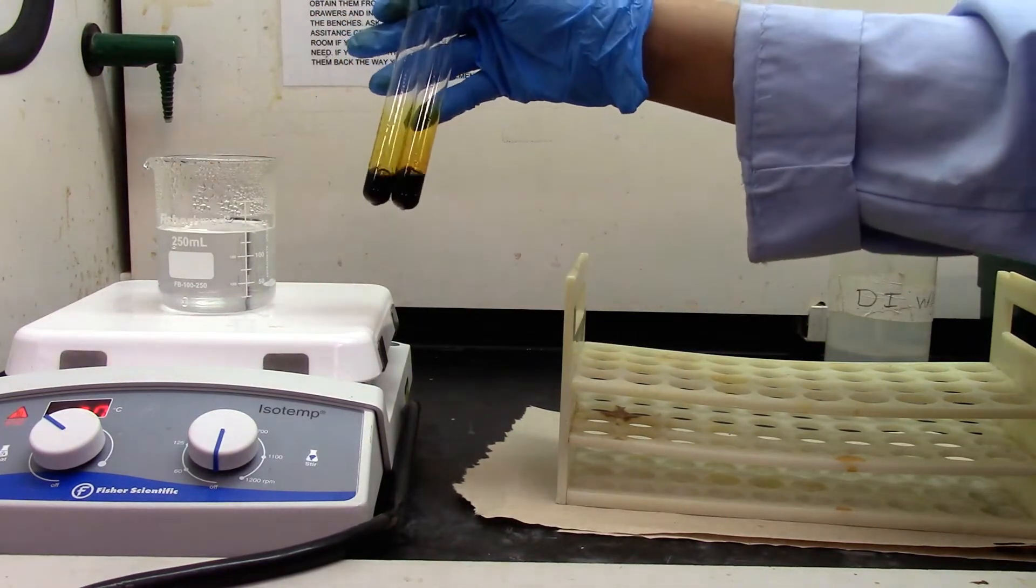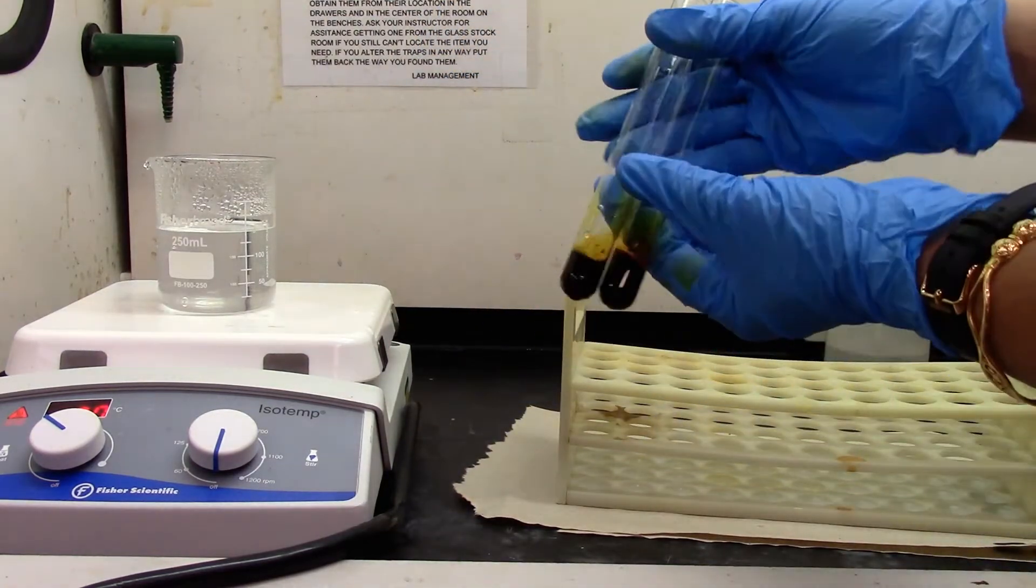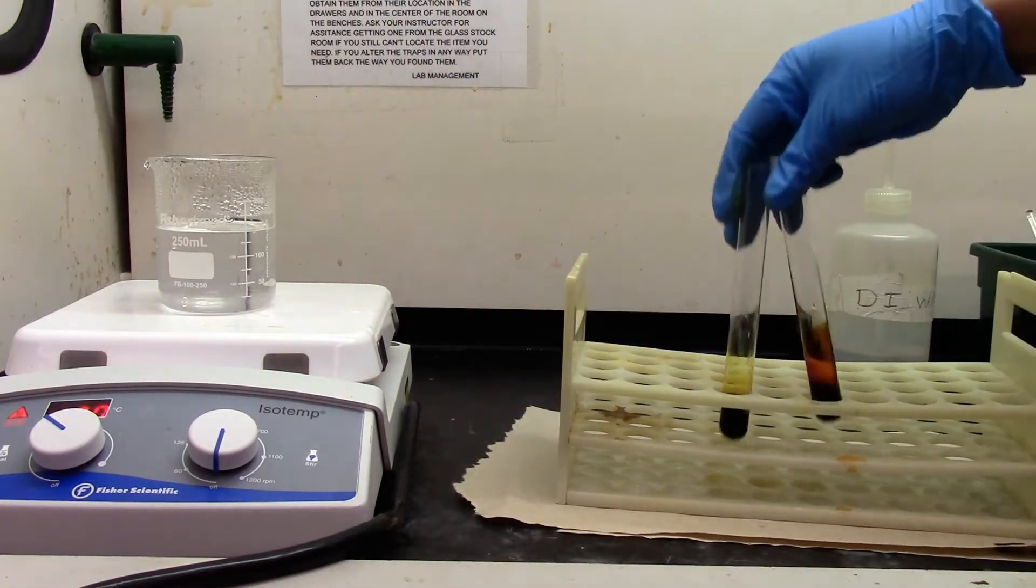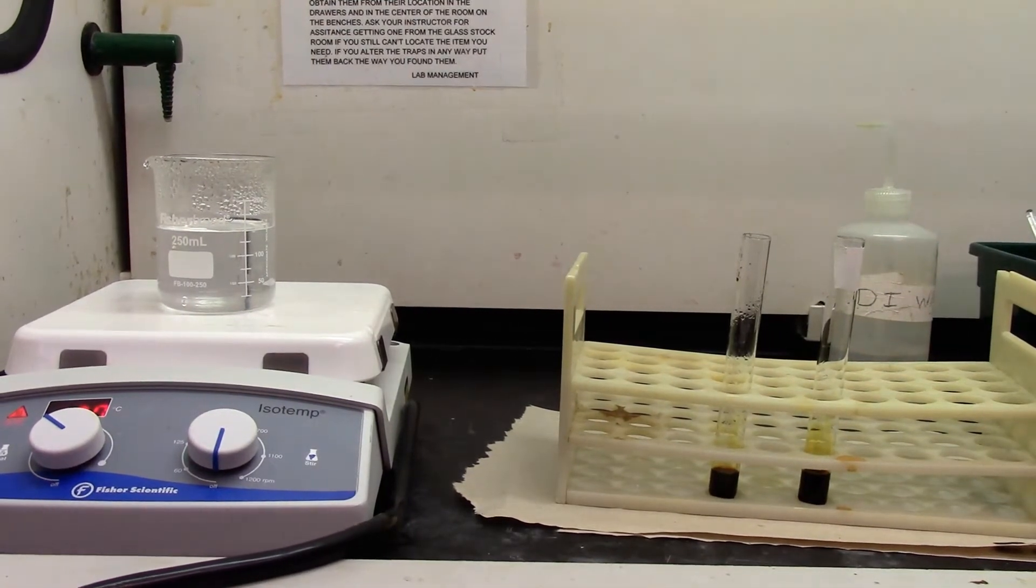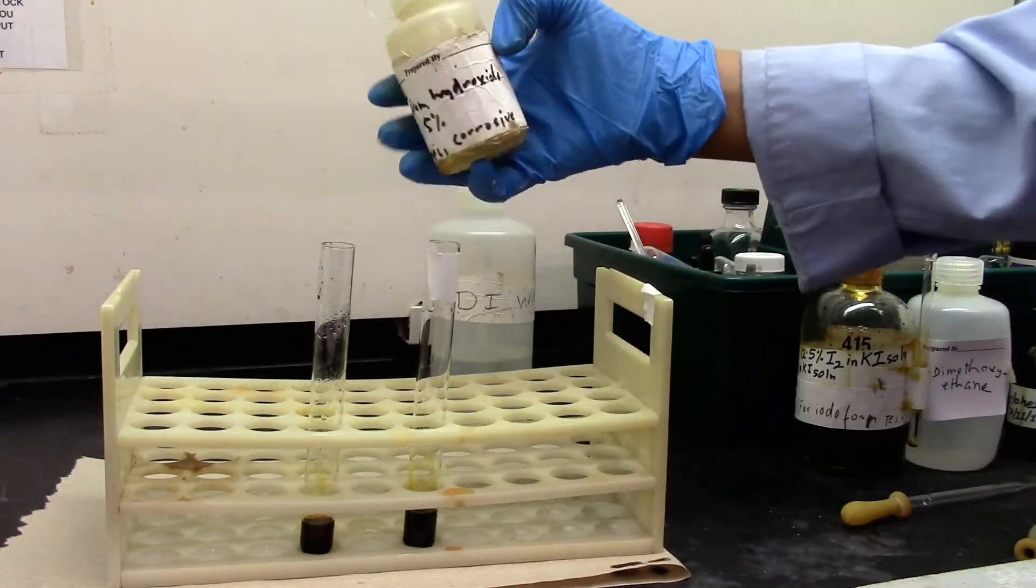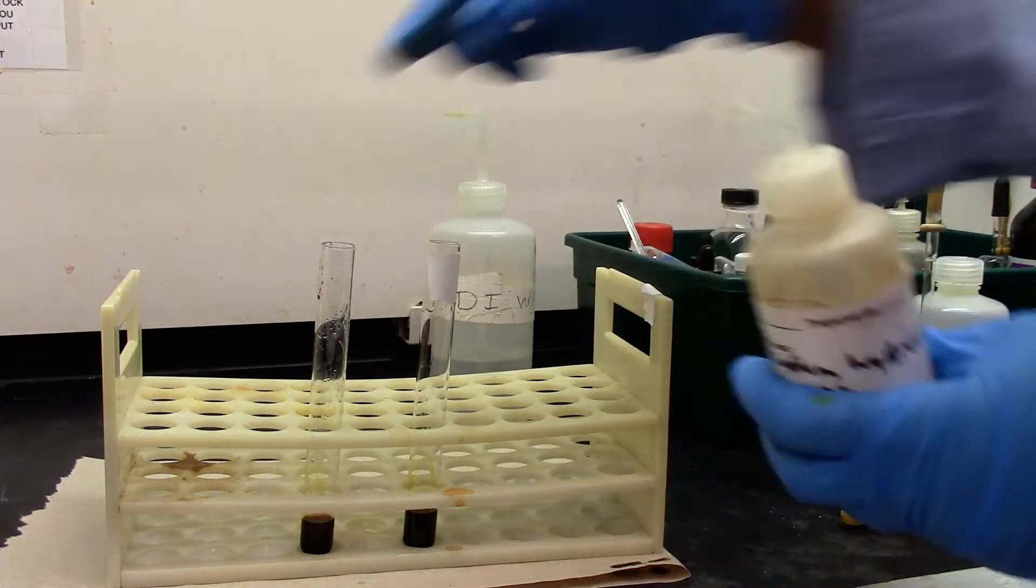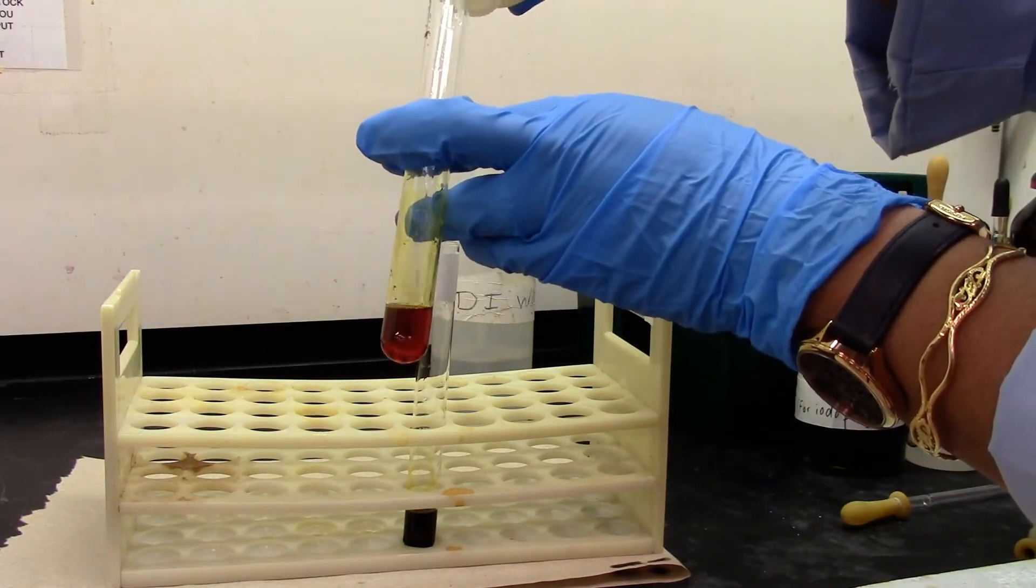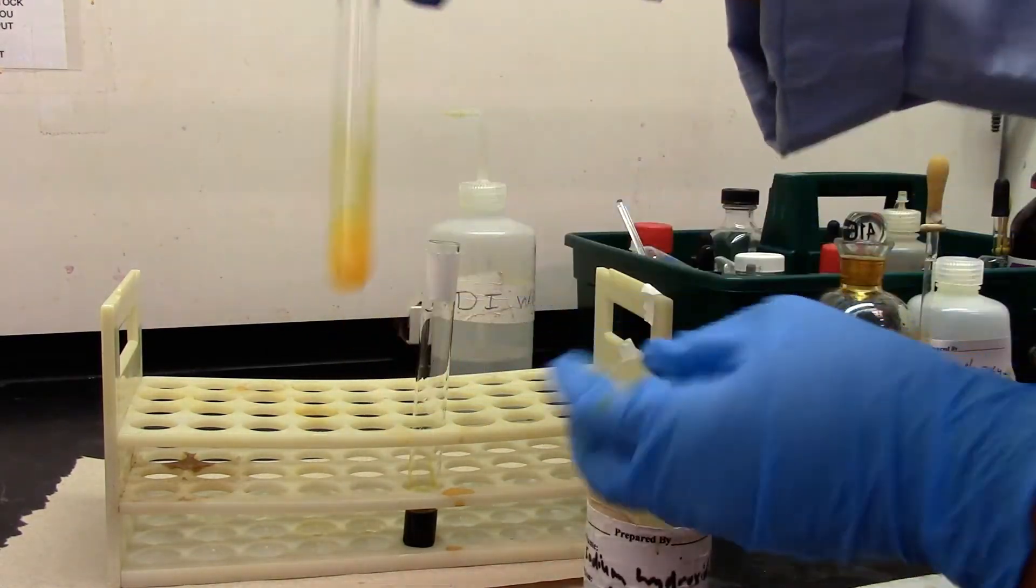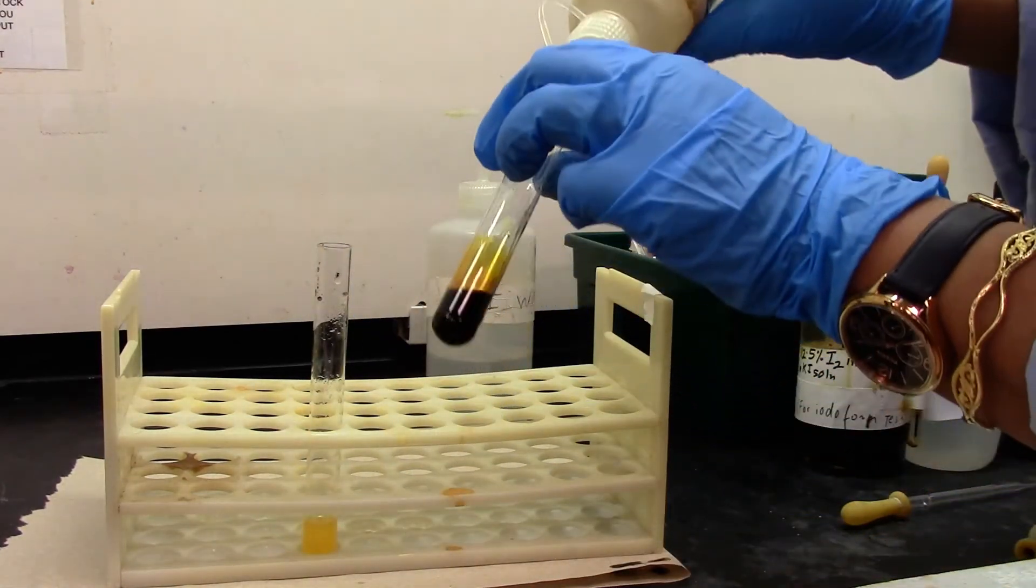The test tube with the iodoform reagent is sitting in the water bath for some time. Now we are going to discharge the coloration with sodium hydroxide.